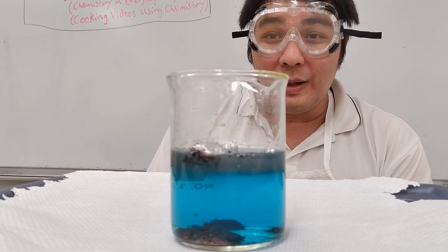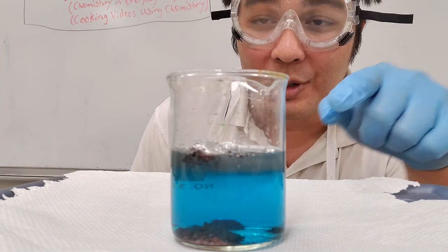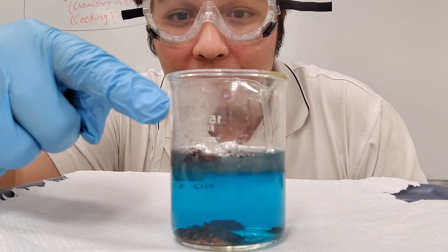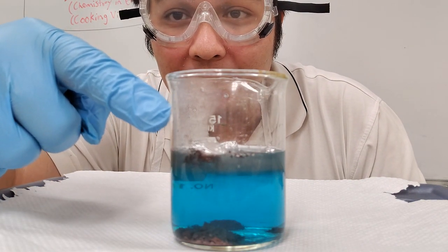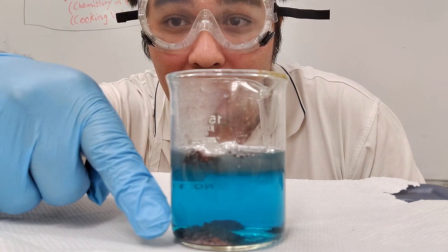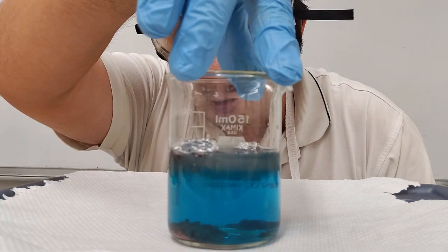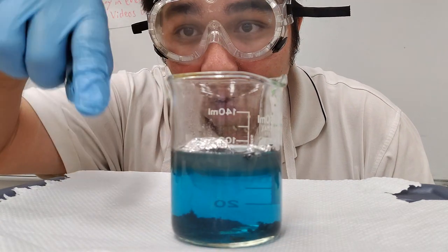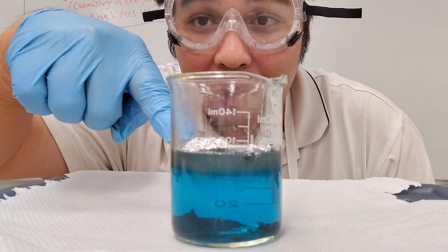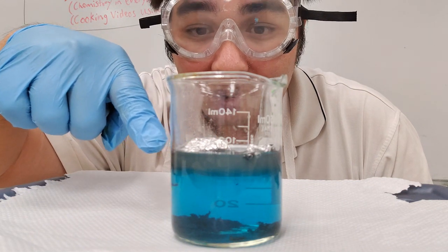And so we're back. So in this part, what I'd like to do is show you guys some of the results of what happened afterwards. As you can see, if I move over here like this, what happened over here was there was a release of some steam. So basically there was an exothermic reaction, and there was a ton of copper that just sank to the bottom after all of the aluminum reacted. If we turn over there, you see some bits of the copper are still being freed from the single replacement reaction, and they're starting to fall, and some of the other bubbles are being freed.